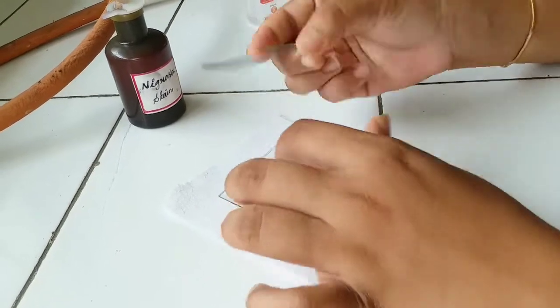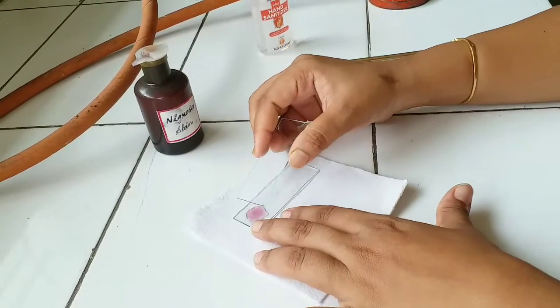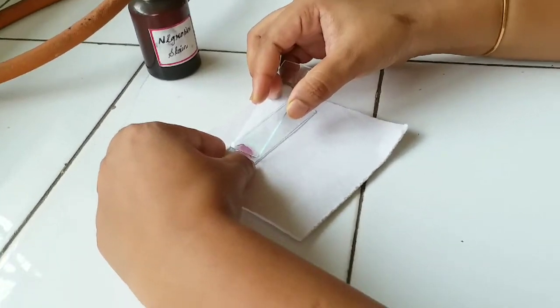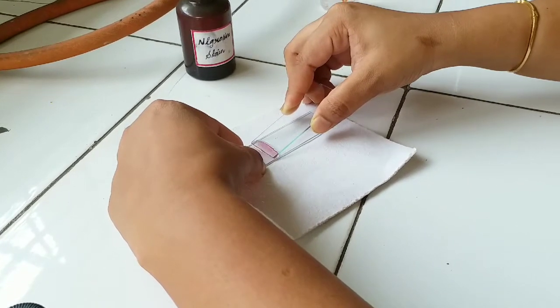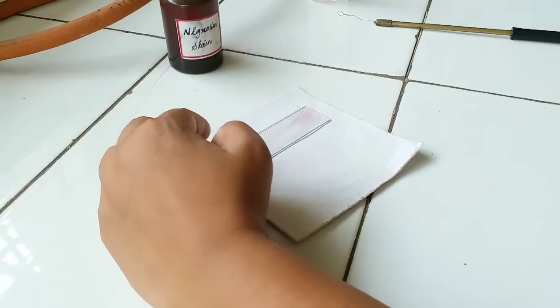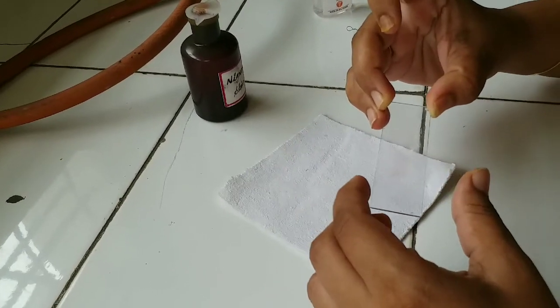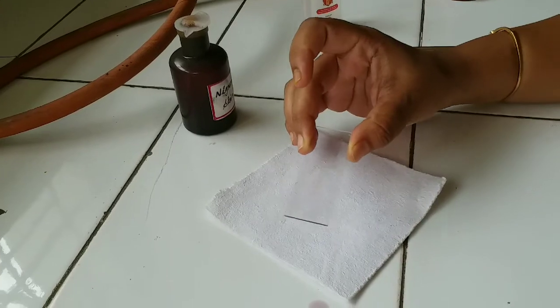After mixing, with the help of another slide edge, you have to make a thin smear. Air dry the slide — let the slide air dry — and then you have to observe it under the microscope.